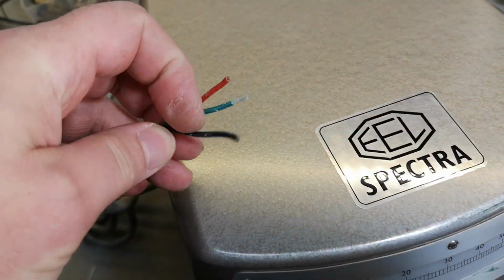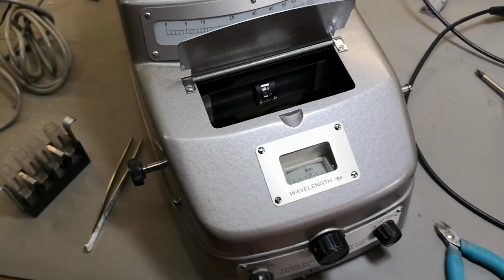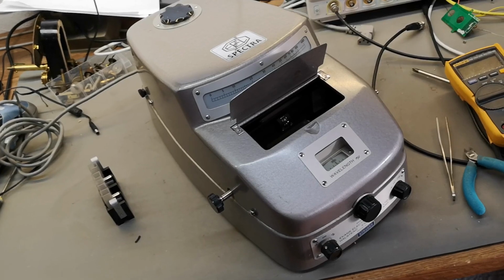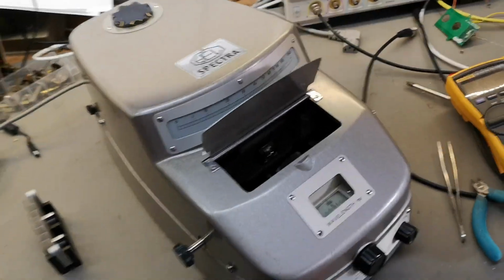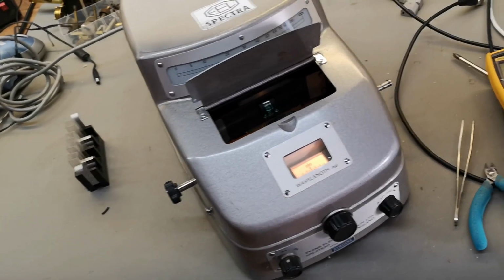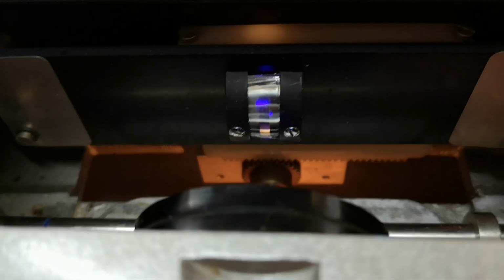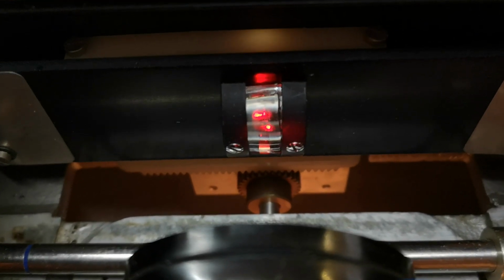So I'll put on a mains connector and we'll see what happens when I power this up. So I dimmed the light a little bit because we're going to do a power on test. And that is mains applied. Ooh, we got light. Oh, how cool is that? 14 watts. Oh, look at that. We got some kind of a sexy color down there. What if I... Oh, look at that. If when I crank the... Now that is something. I am in love.